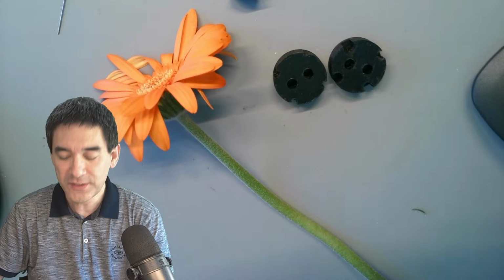Why not all of them? Because not all of them are suitable. I would like to explain this to you first. So this one here is the so-called Barberton daisy. I need to focus this a little bit. I used an app to identify the flower. It seems to be native to Africa.